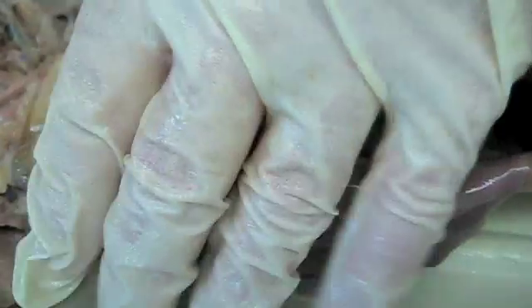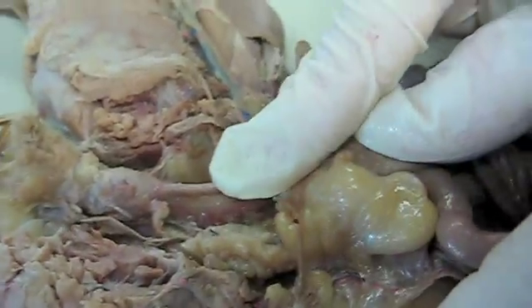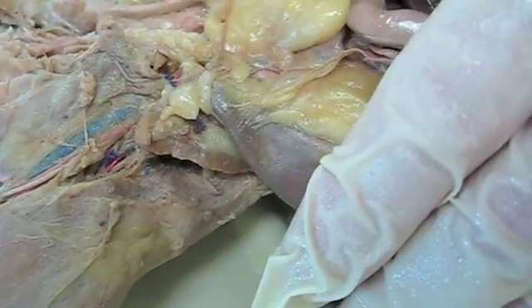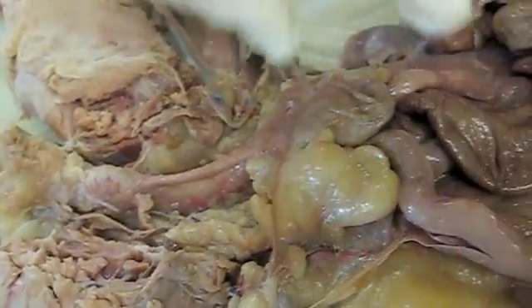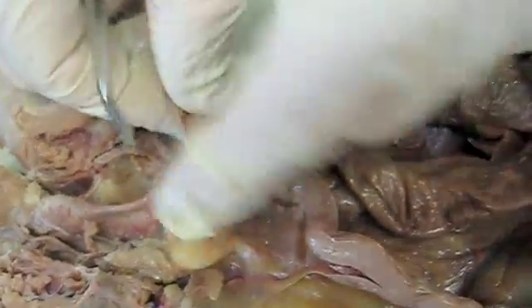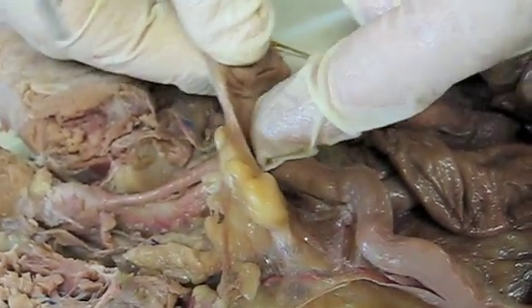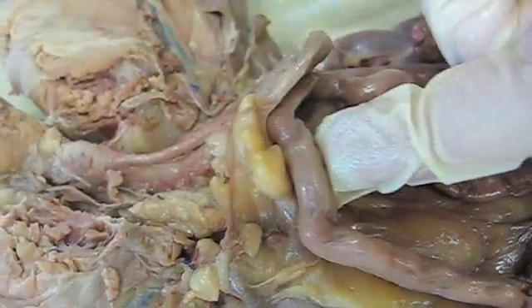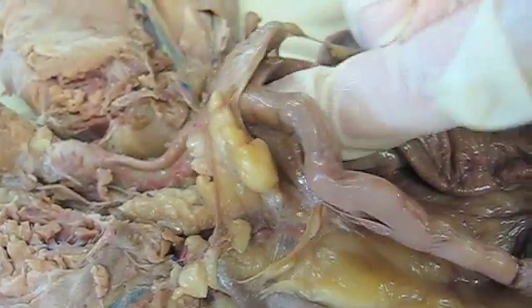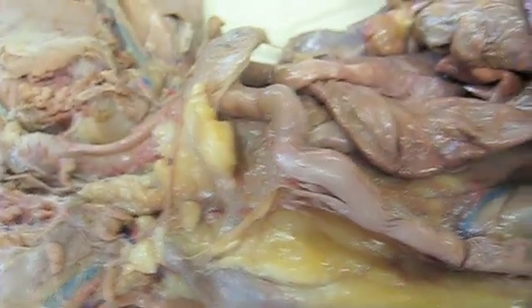In terms of the pouches: the pubo-vesical pouch is right here — I cut through the pubic bones so we could open this up. In between the bladder and the uterus would be the vesicogenital pouch. And then between the uterus and the rectum would be the rectogenital pouch. So females have three pouches; males have two.